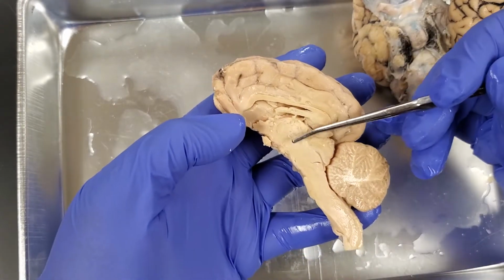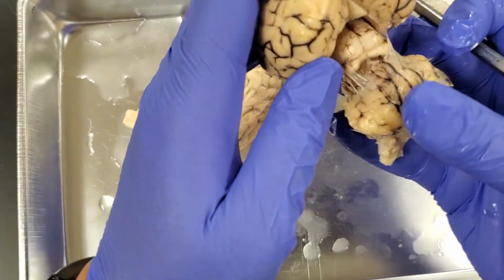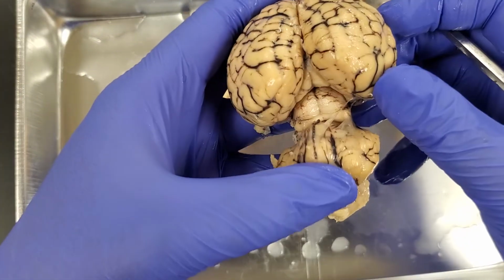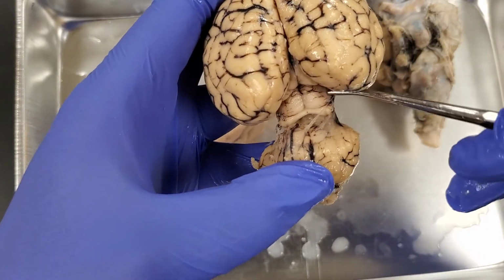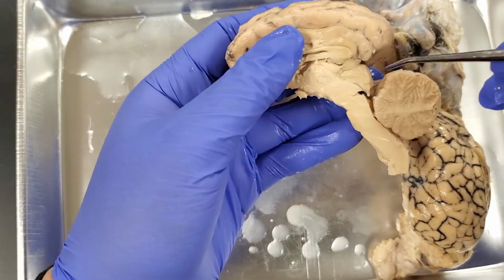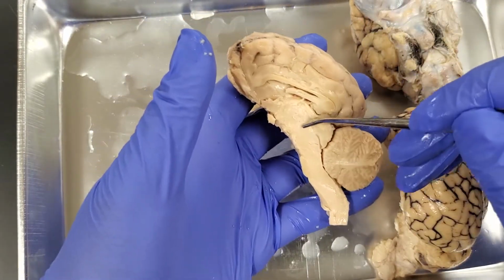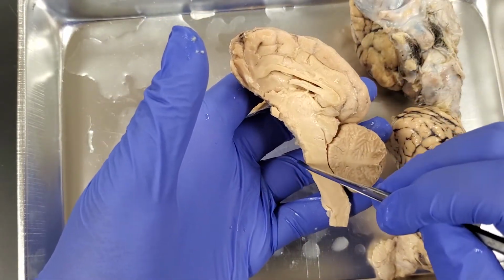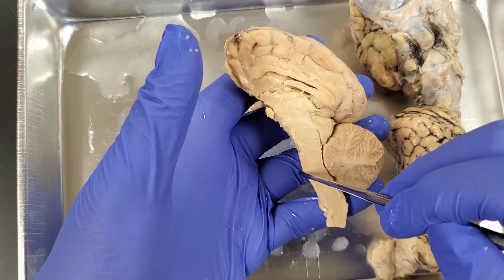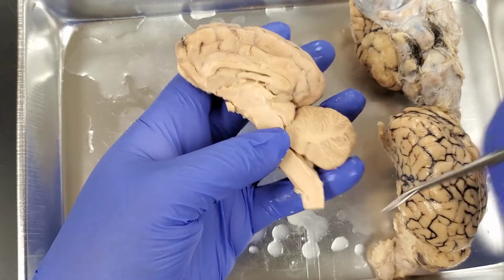Moving down into the midbrain, I want you to notice that if I pull the cerebellum apart from the cerebrum, as we're looking into this area, you're going to notice basically these four protrusions: 1, 2, 3, 4. That's the corpora quadrigemina, and we can actually see two pieces of it here. Corpora quadrigemina is used for auditory and visual reflexes. As we move down, this little bump here is the pons. It's quite a bit smaller in sheep than it is in humans. From there, we're going to go into the medulla oblongata and then into the spinal cord itself. So that's the spinal cord.